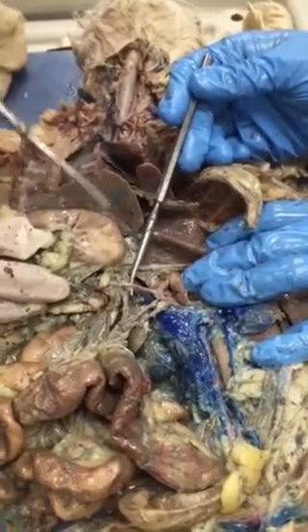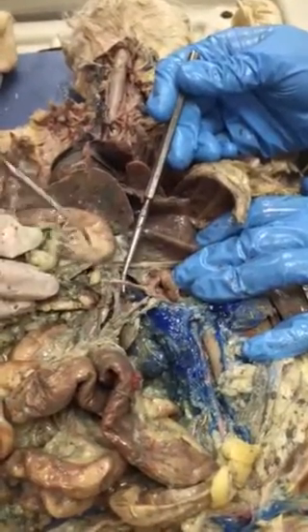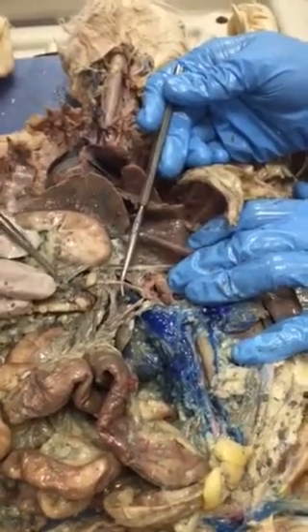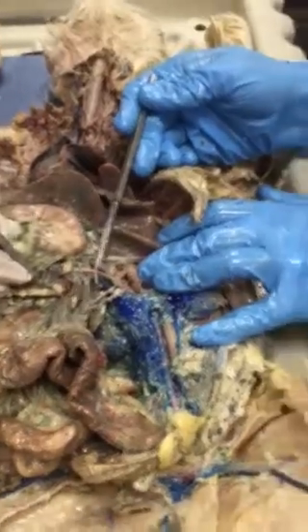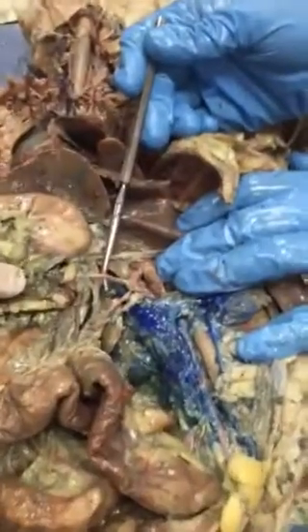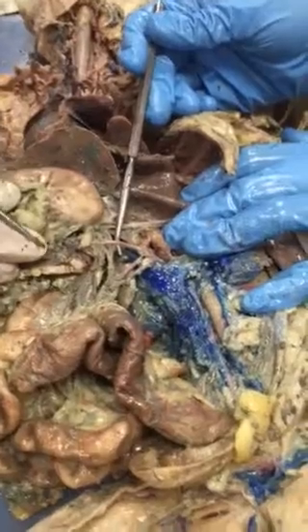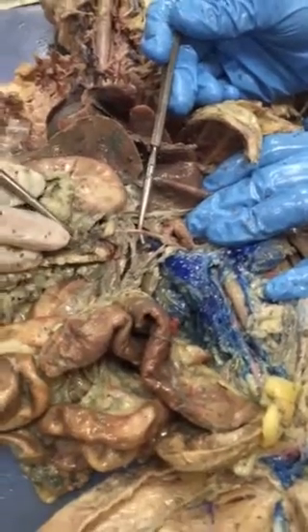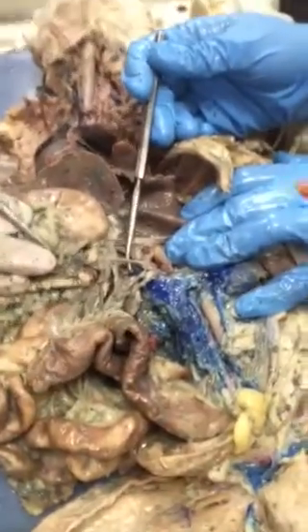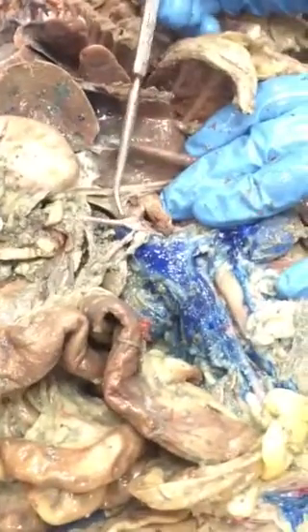For instance, on the practical, you're not actually going to point at it, but I could say this could be pin number 15, and I could ask you what three branches come off the celiac, or name at least one branch that comes from here. When you do that, are you going to show us other vessels so we can know this is the first one and not technically the second one, like the second vessel underneath? I should have everything dissected out so that you can identify it. Okay.